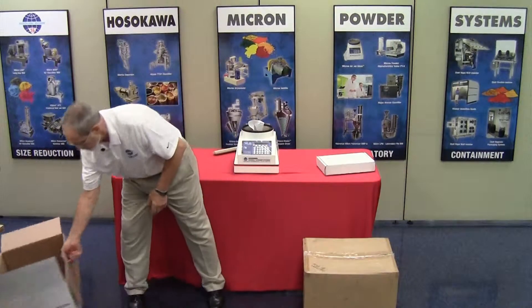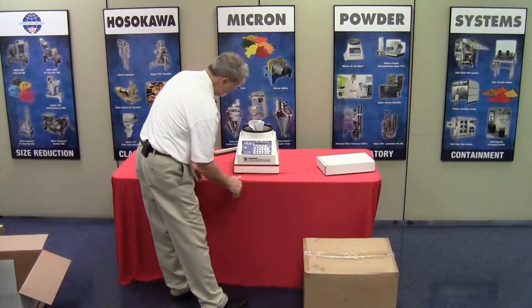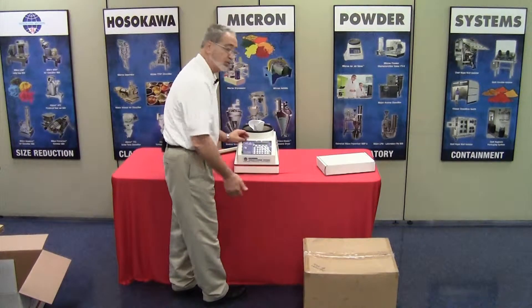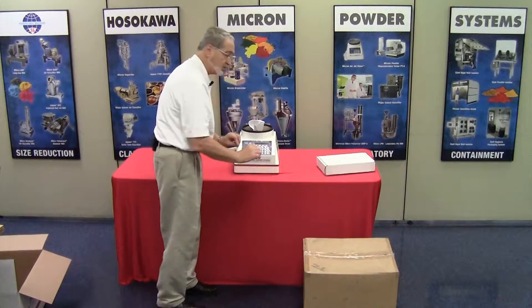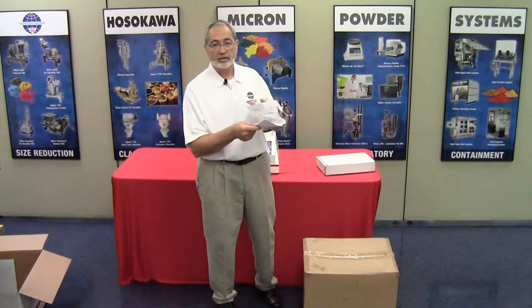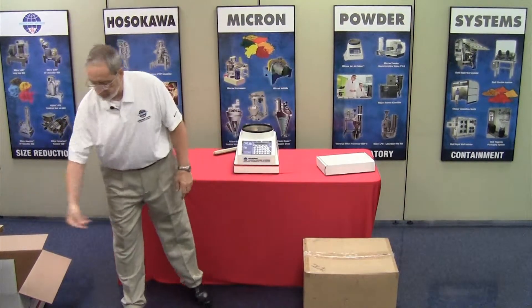You'll notice that the unit has a protective cover over the control panel. The protective cover can remain in place, or remove it simply by slitting the four little tabs and peeling it directly off. In the discharge throat, you will find the static quality control form. I would record that or put it in a safe place so that you can have it for future reference.